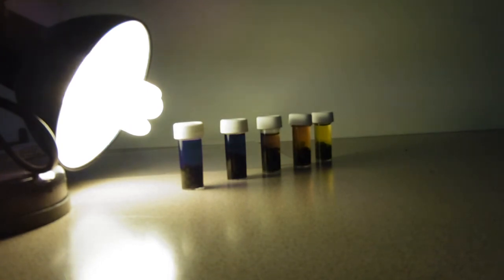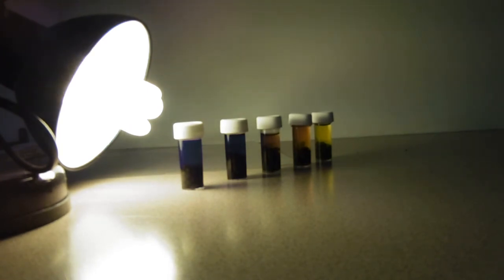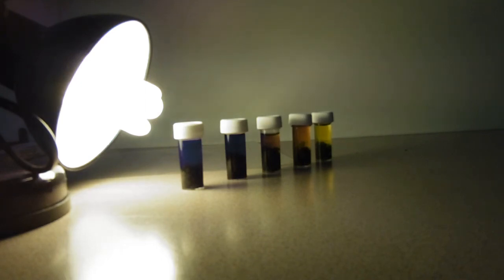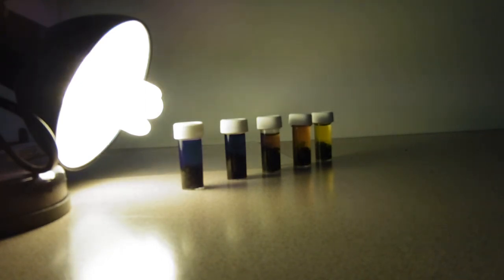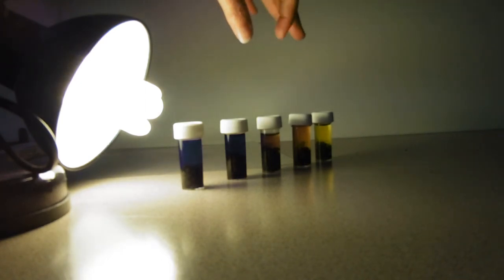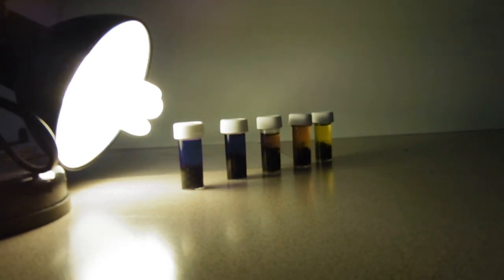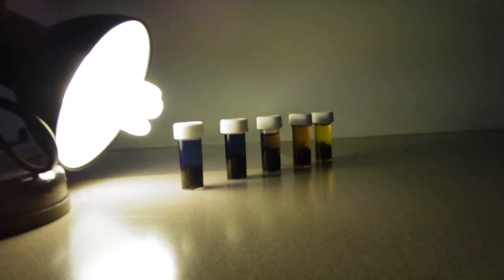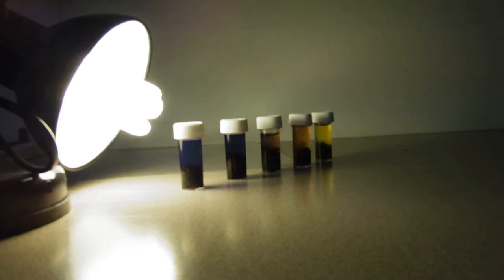For people who are red-green colour blind, some of these yellows and oranges are really quite difficult to distinguish. So you couldn't really do it by eye if you were colour blind.